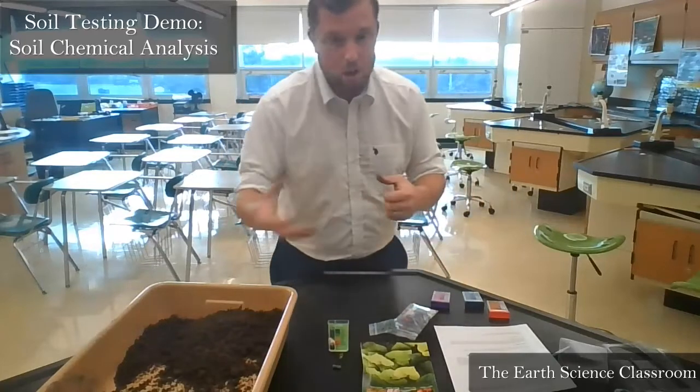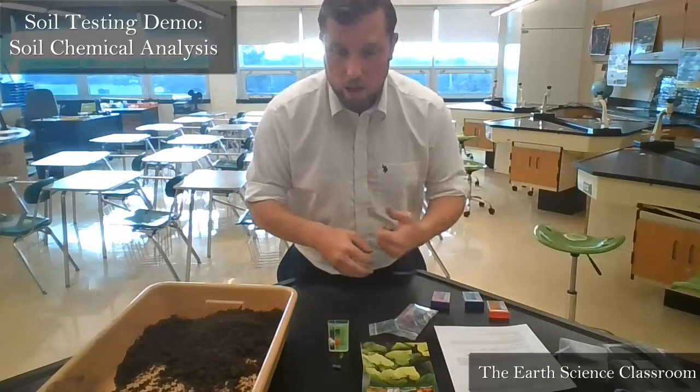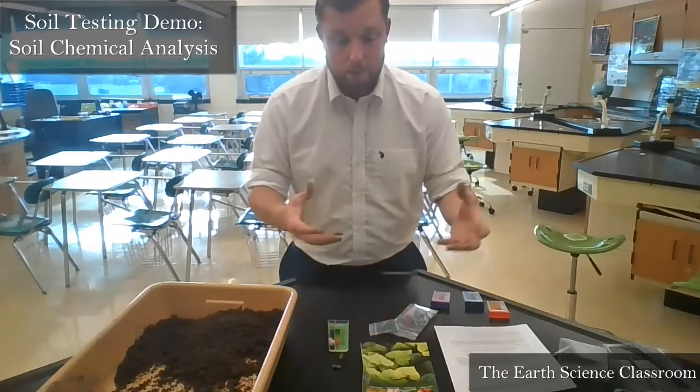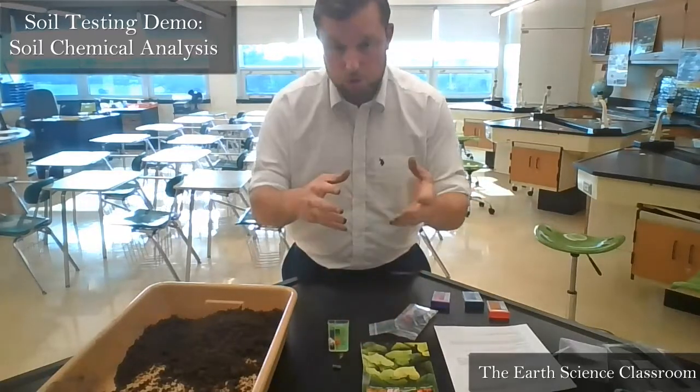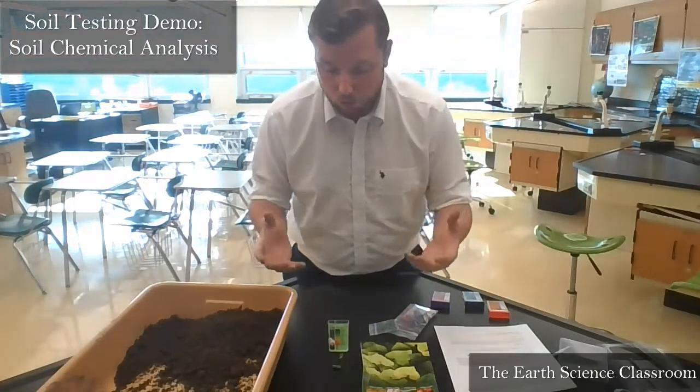If you go to lunch after this period, make sure you go to the bathroom and wash your hands thoroughly with water and soap. Please don't eat with any chemicals on your hands. Now, if you want to use gloves, we have gloves in the corner, so feel free to use gloves if you want to.